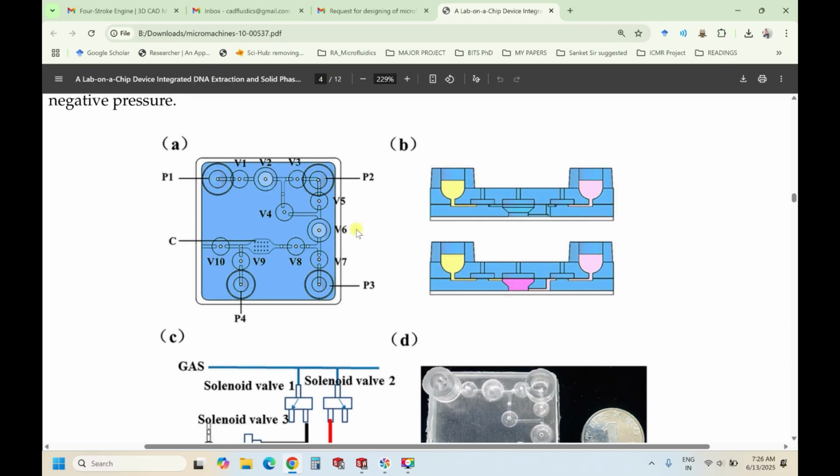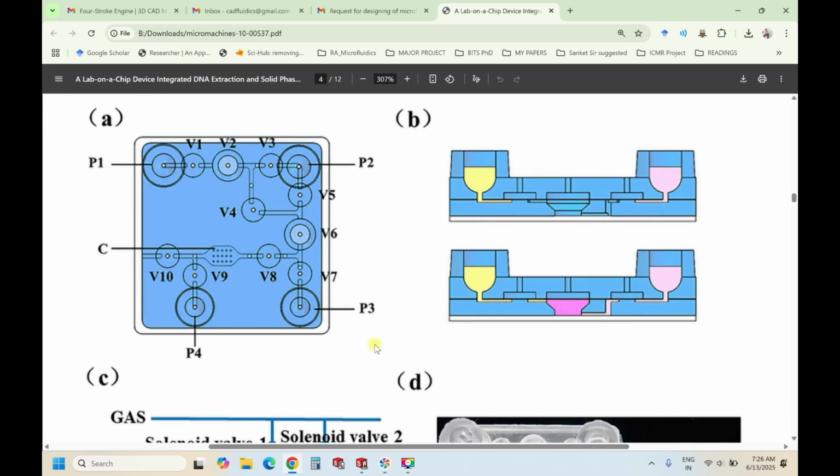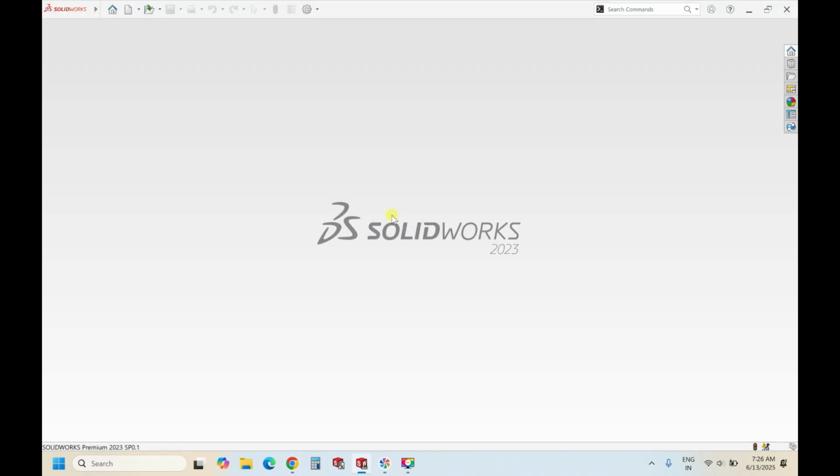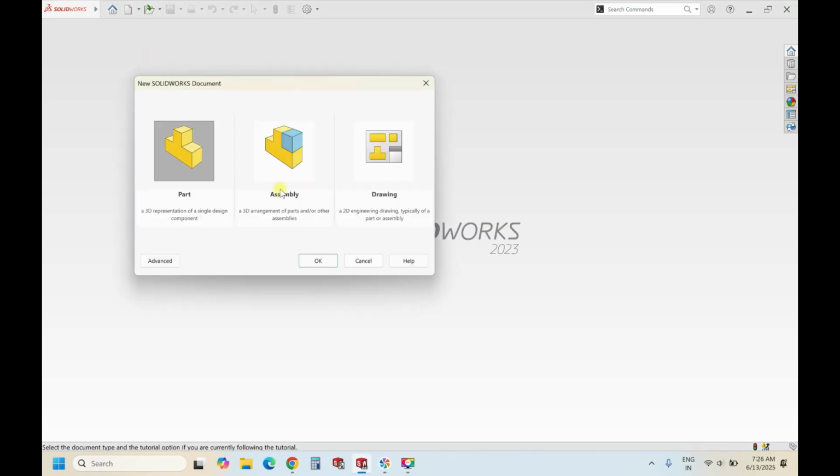All the dimensions and everything I will change, because I am not going to mimic the same. Instead of the copyright issues, since it is for educational purpose, we do it with our own dimensions. So open the new assembly file.